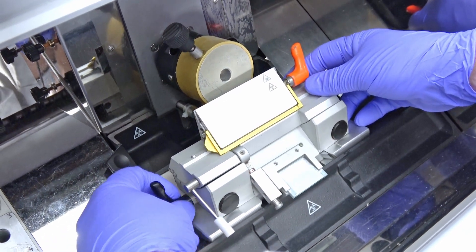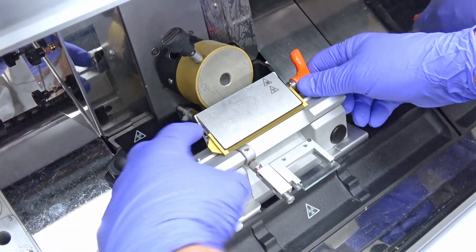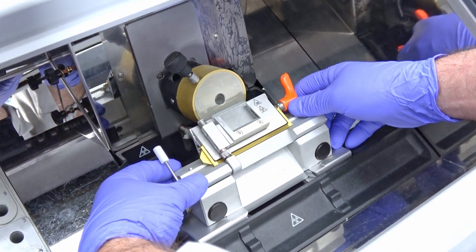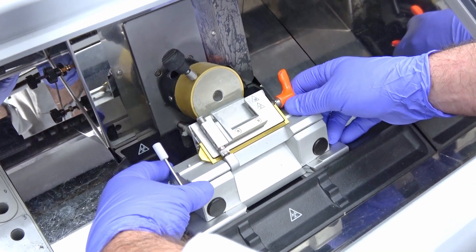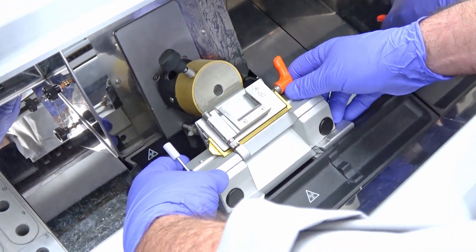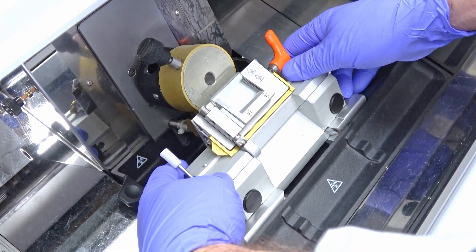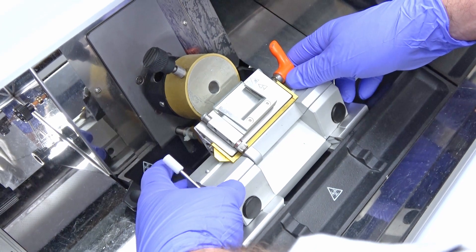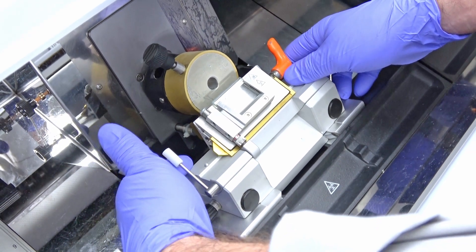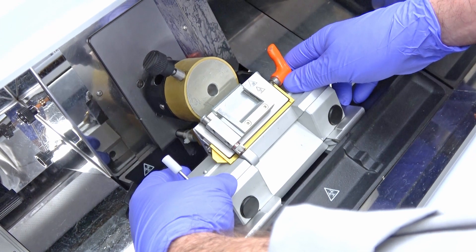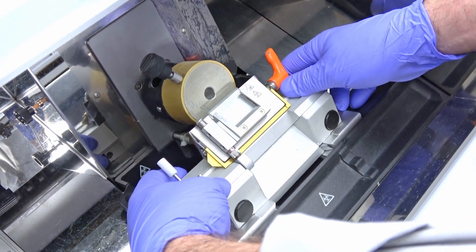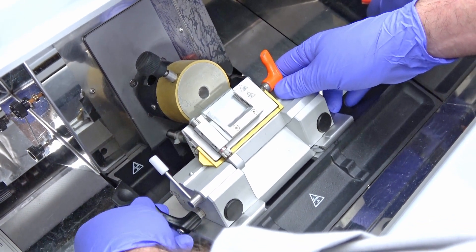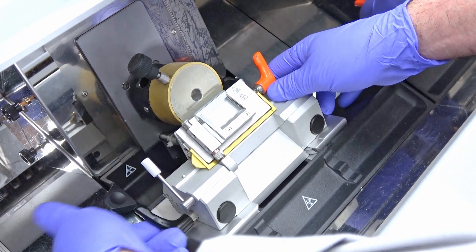This one loosens and slides the tilt or the angle or the degree of cut you're going to do. That's a very important one because for your cutting ribbon you need to really find that accurate point. You're going to start on the zeros but then you need to tilt in on it or tilt back. Usually you've got to bring it down a little bit to get that ideal cutting spot.